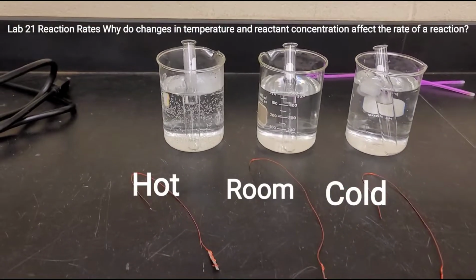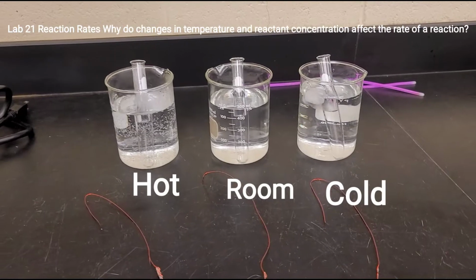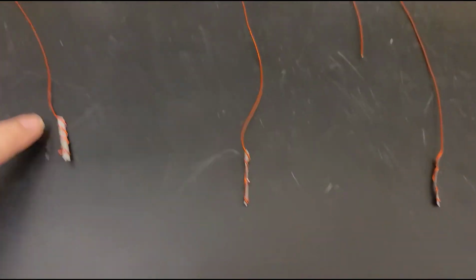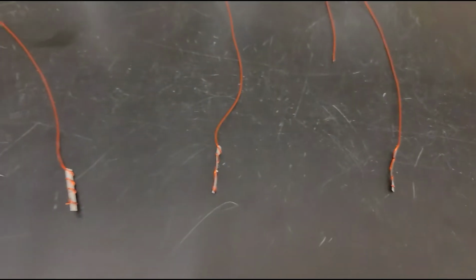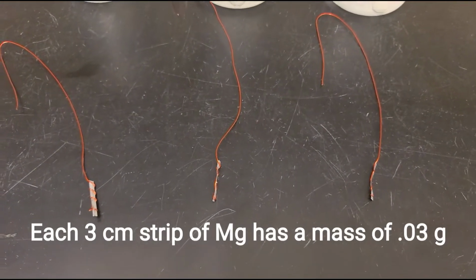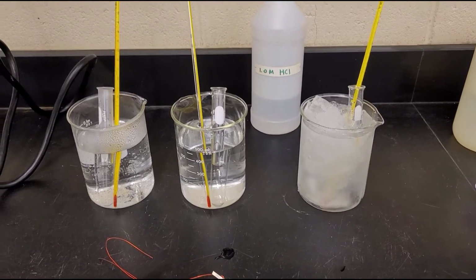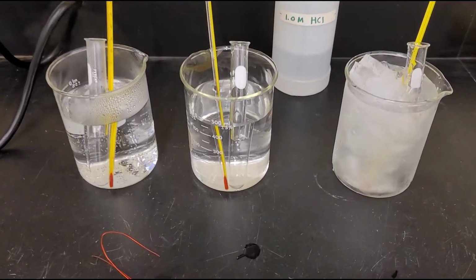This is Lab 21, reaction rates. Why do changes in temperature and reactant concentration affect the rate of a reaction? So I have 3 centimeters of magnesium in each little thing here, and I've taken the weights of all the magnesiums, and they're all going to go in 1 molar HCl. But now, instead of testing the different concentrations, I'm going to be testing the effect of different temperatures.